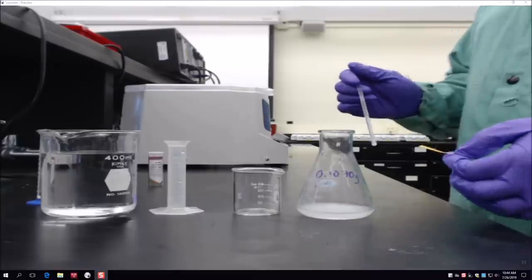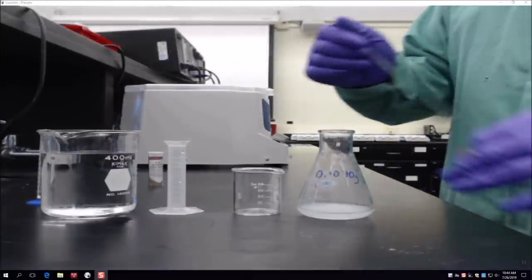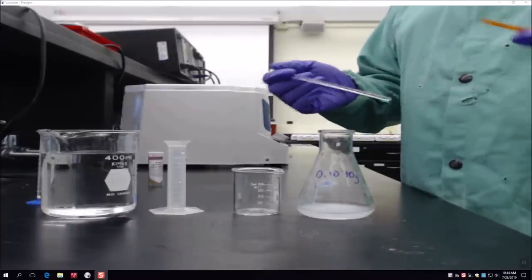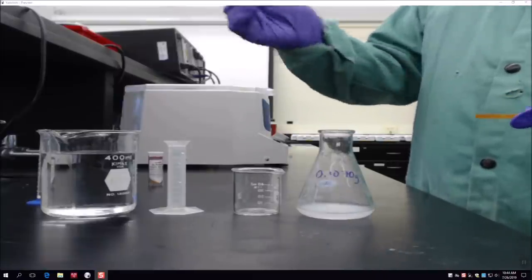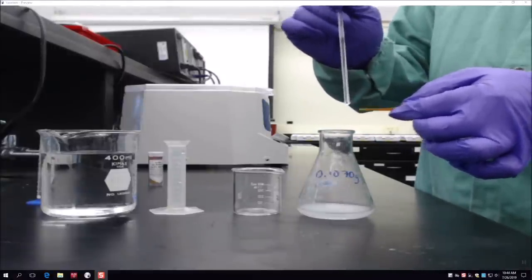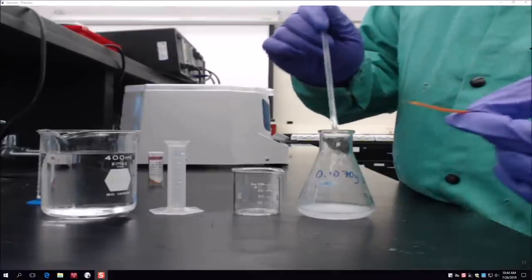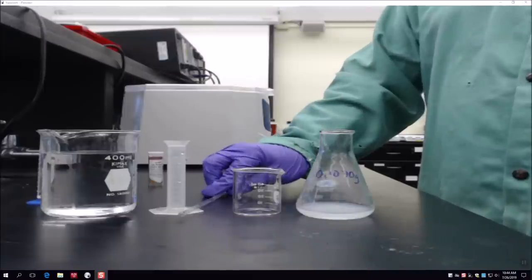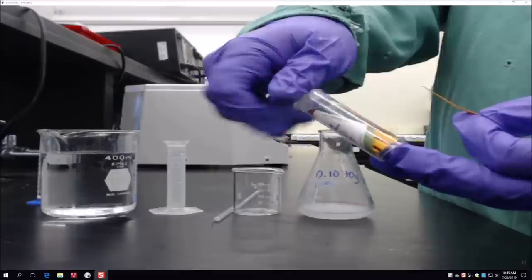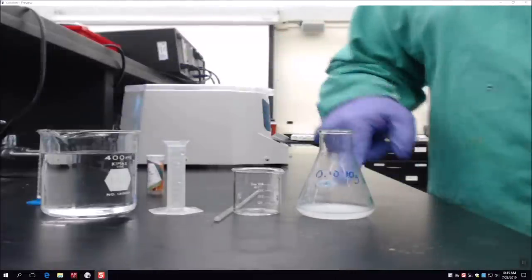To test with pH paper, don't just dip it in — instead, dip a glass stirring rod into your solution and touch that to the pH paper. You can see it's turning green or blue, which on pH paper means it's a basic solution. The bottle of pH paper has a color guide on the corners. Because we formed precipitate, we know we've already neutralized all our HCl so that NaOH could react with the magnesium chloride.